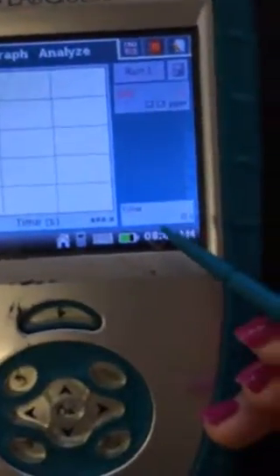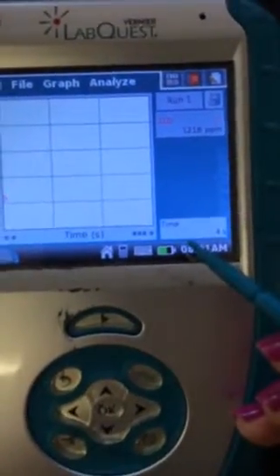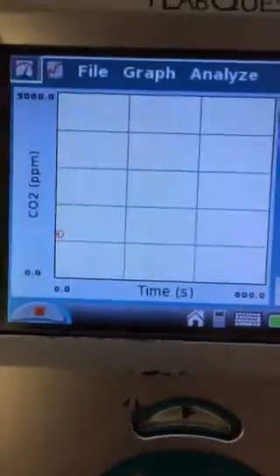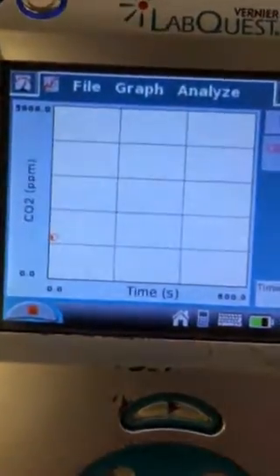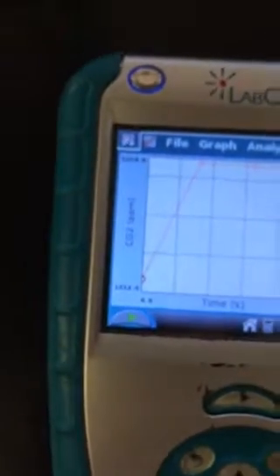Now the default settings tell it to record in a certain way. On the right here, it says time, and it's going by every 4 seconds. Down here, it also says that it's going to stop at 600 seconds, and it's making a little graph for you. So it's recording a value every 4 seconds for 600 seconds. Eventually it'll stop on its own at 600, but I'm going to stop it myself to show you another way to carry that out.